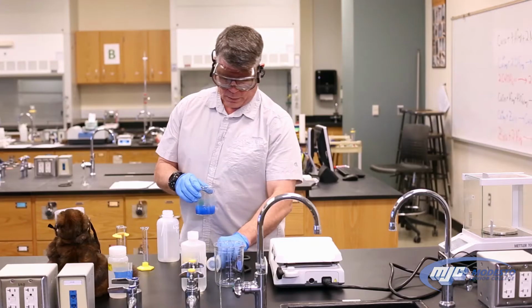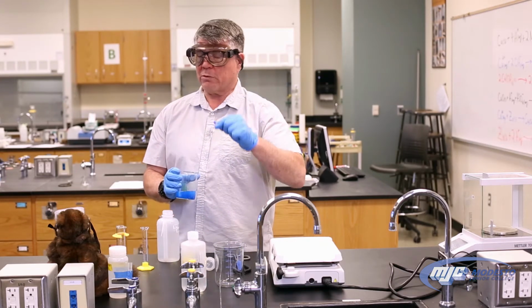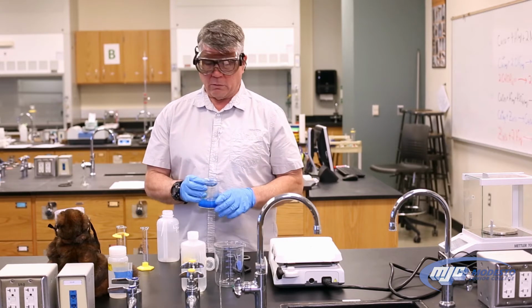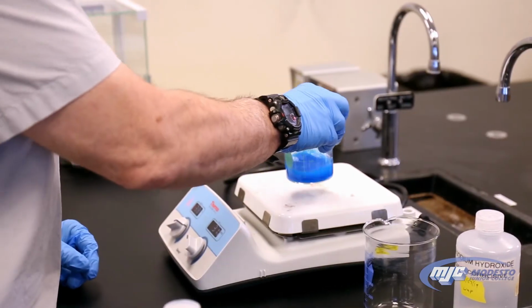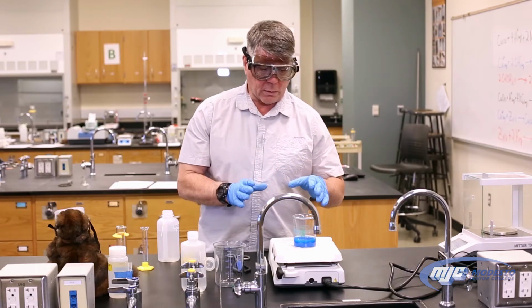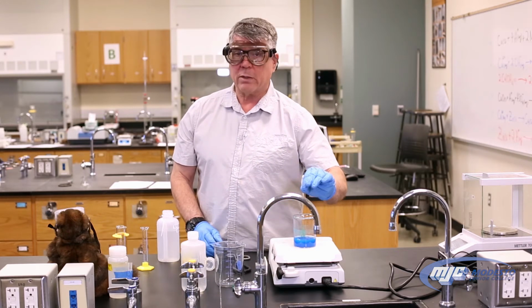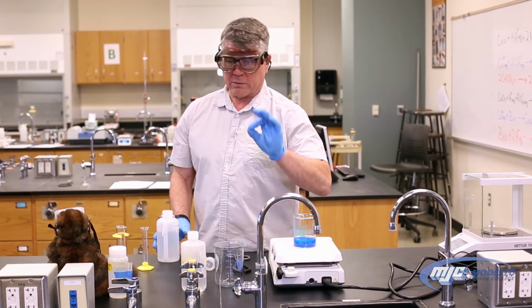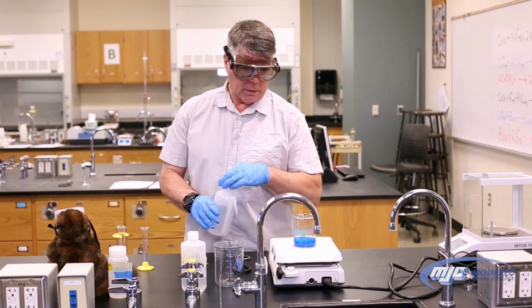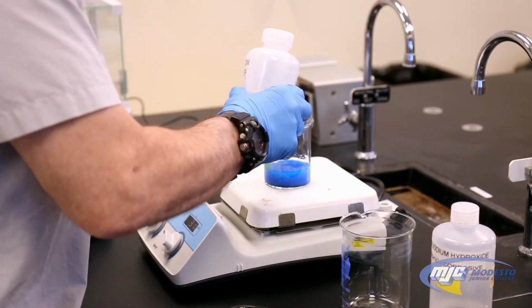Put it on. I'm going to take my magnetic stir bar because as in the gravimetric analysis lab, if we don't continuously stir this, it will bump and it shoots everywhere. So we're looking, guys, for the same thing that we did in gravimetric analysis. We're looking for this bright blue color to turn all dark brown. That's the copper 2 oxide from the copper 2 hydroxide. We also want to make sure that we rinse down the sides, get all that copper in solution.